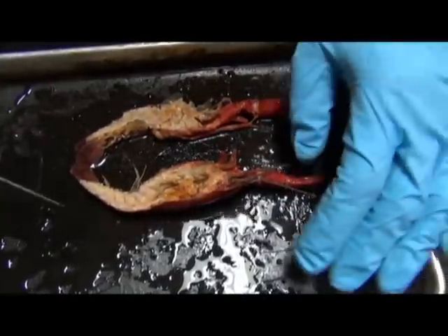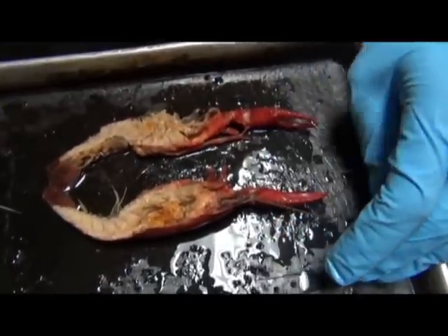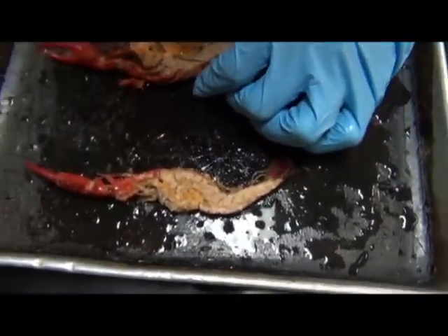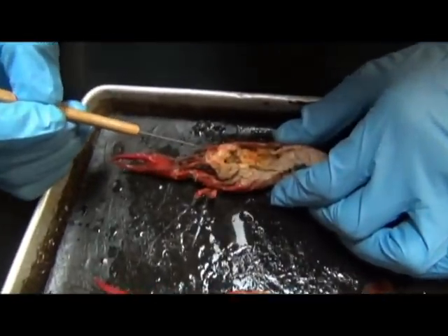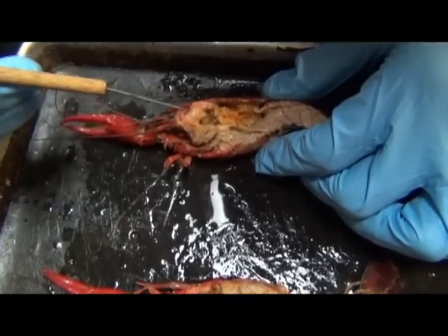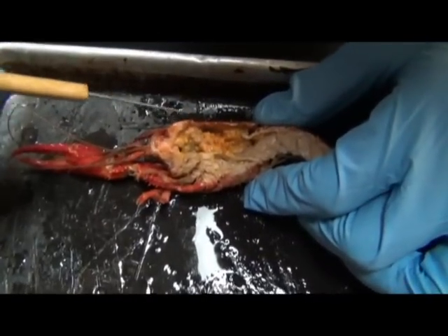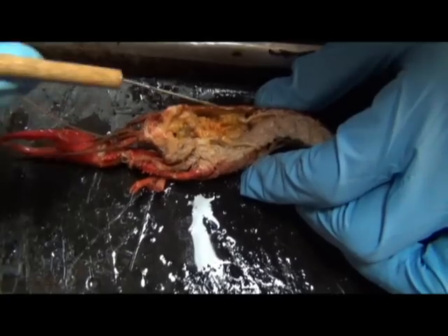If you remember what I had said about the externals of the animal, what I'm going to do is talk about this half right here to illustrate some qualities. Well, here are the eyes. It's the carapace. Right here. Right here in this general vicinity is the stomach.